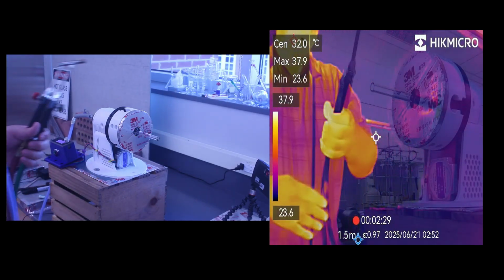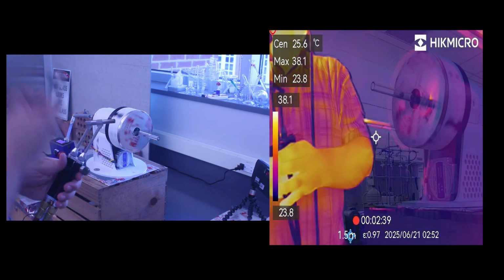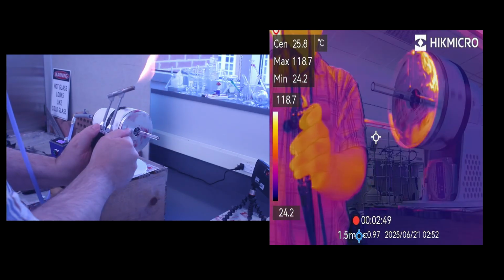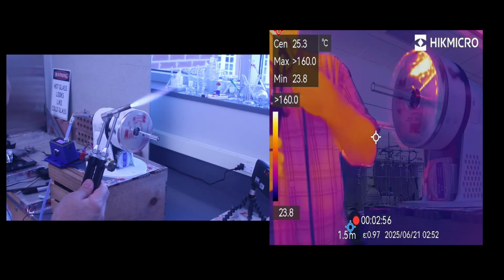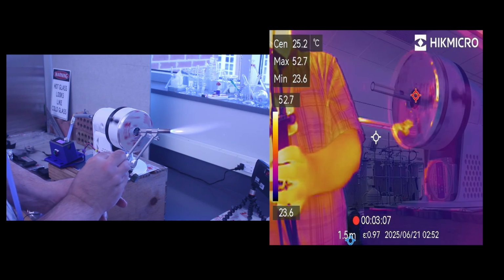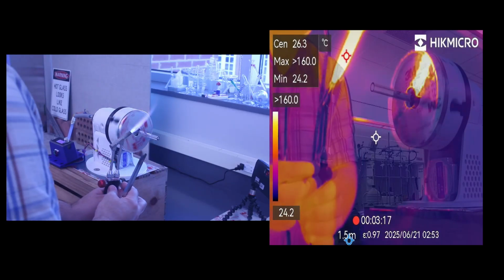Alright, so if I sound odd, like I am now, it's because I've got my blow hose in my mouth, and got the heat shield already on. Start rotating it. Again, not perfectly centered, but good enough for what we're going to be doing. This glass tubing is standard wall, 11mm, so it doesn't need a very intense flame. So I can actually turn this oxygen down just a tad, and then turn my gas down. That dialed in, and that'll be sufficient. Okay. Glass is on, and here we go.